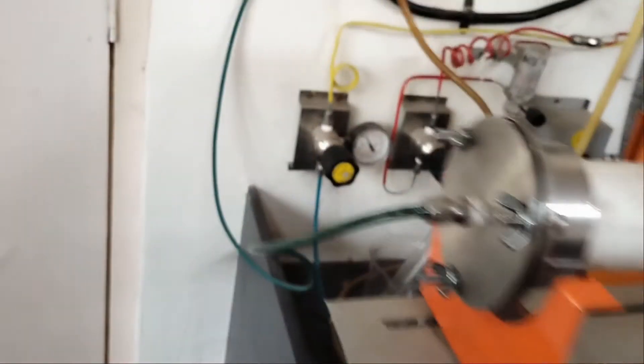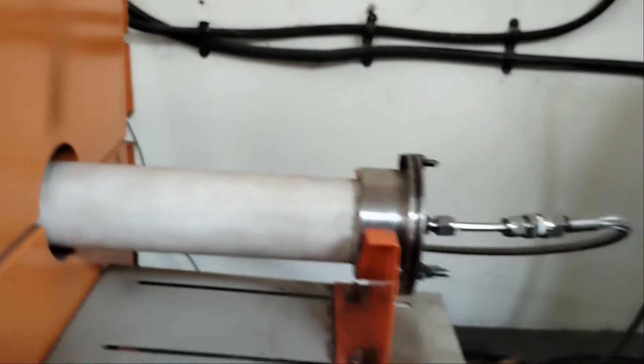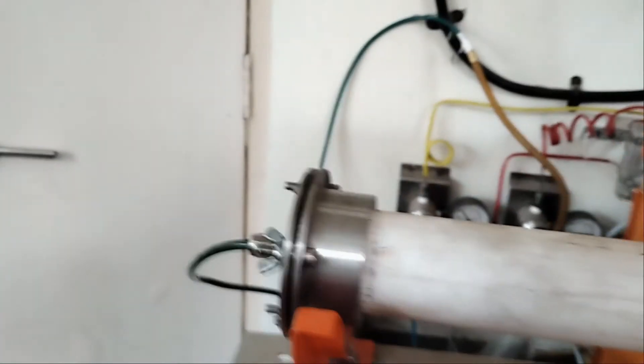The bubble will indicate the gas is flowing. So the right side is actually the inlet, and the left side is actually the outlet. The outlet is taken out of the system.